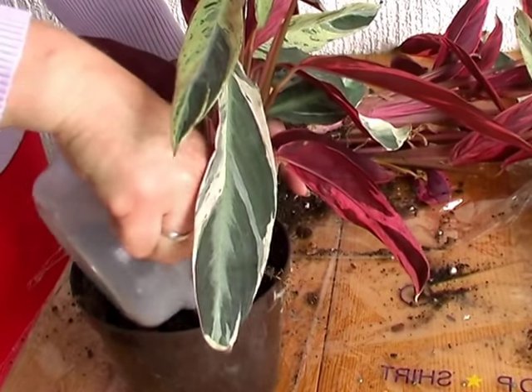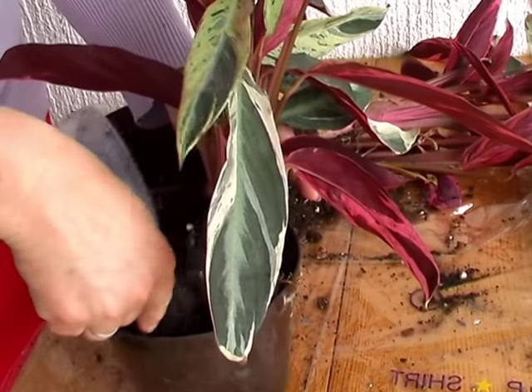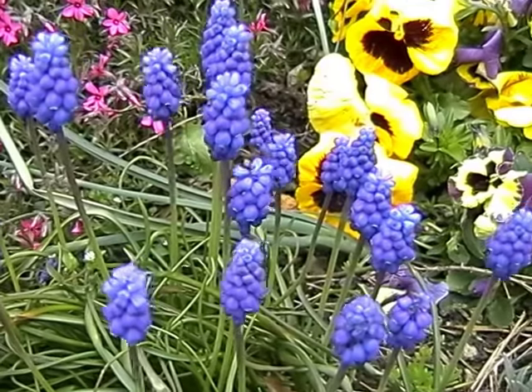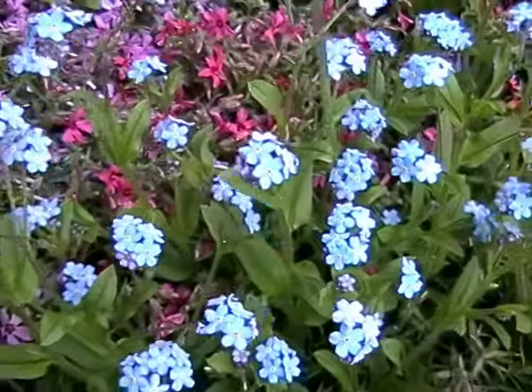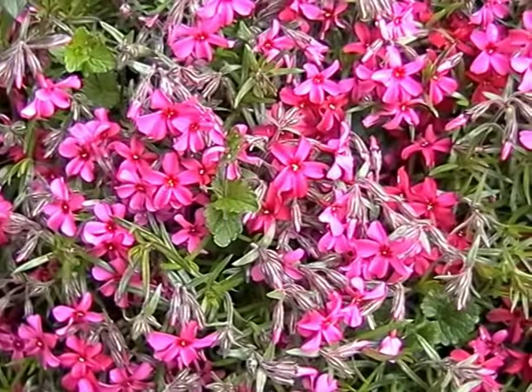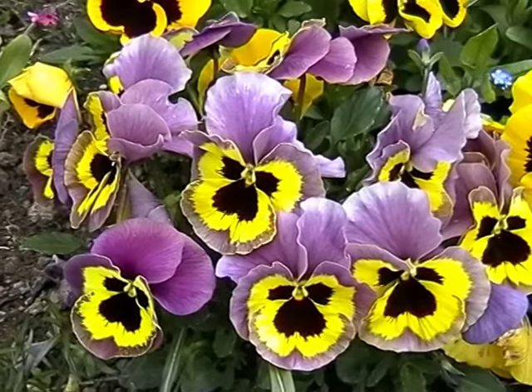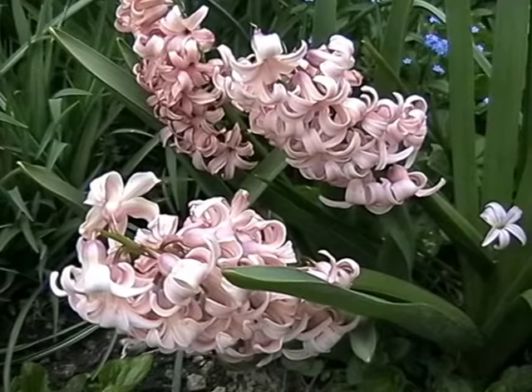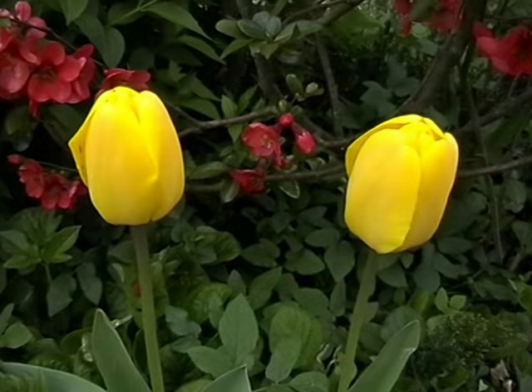Phosphorus is a very important nutrient for plants. For this reason, the content of phosphorus in topsoil that is sold commercially for garden application is measured by the manufacturer. What you will see in the following video is a typical example of a measurement in chemistry.